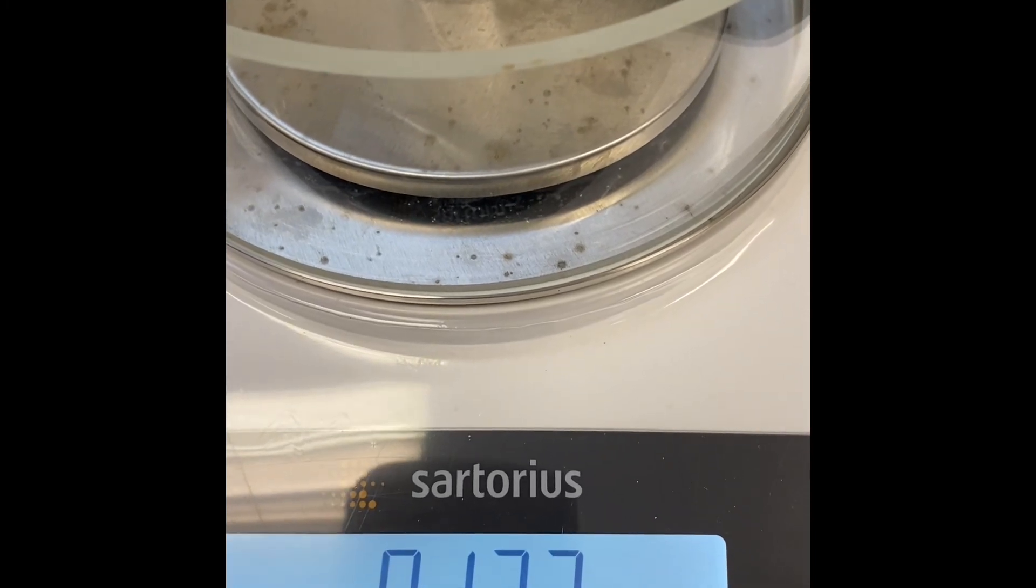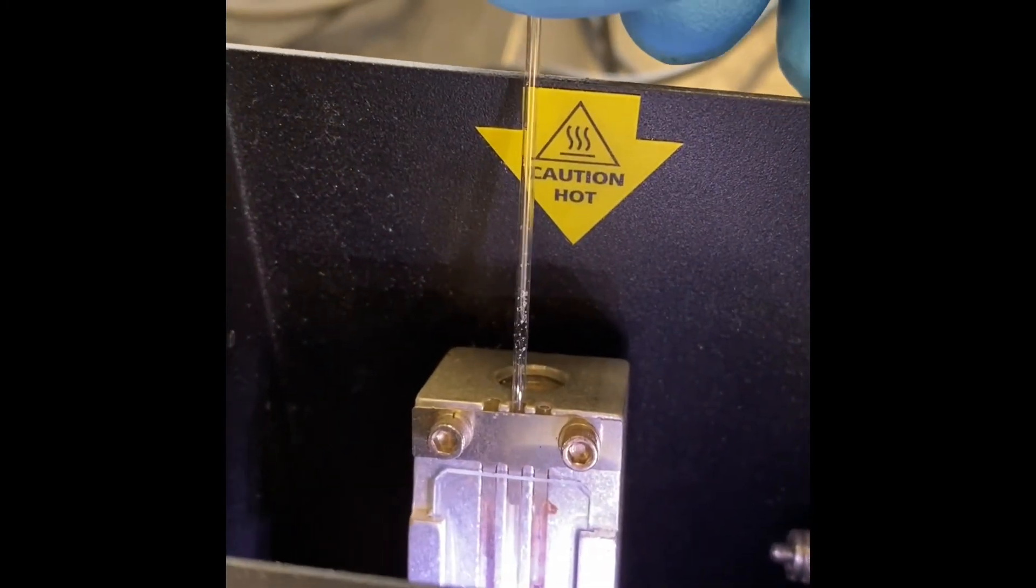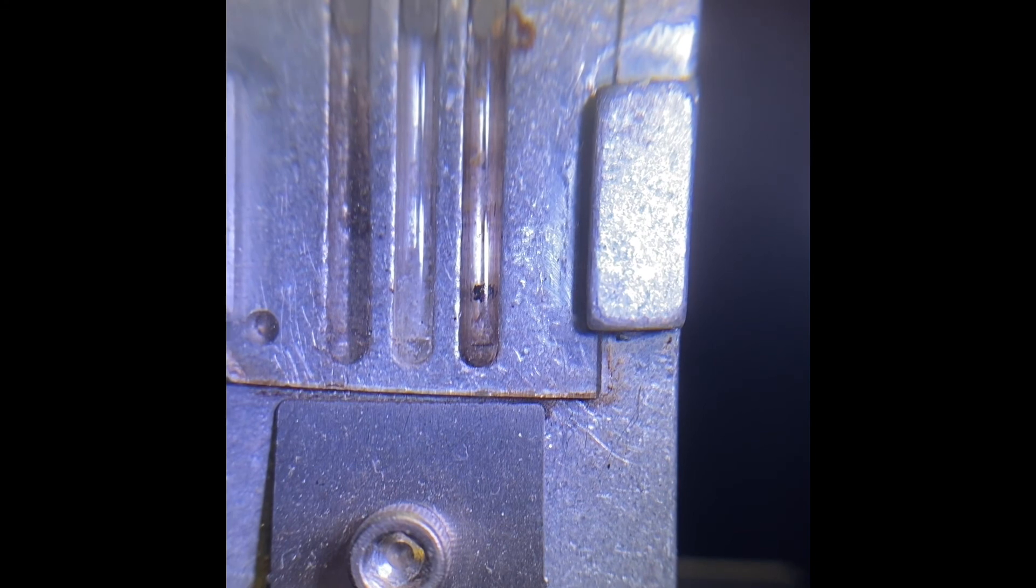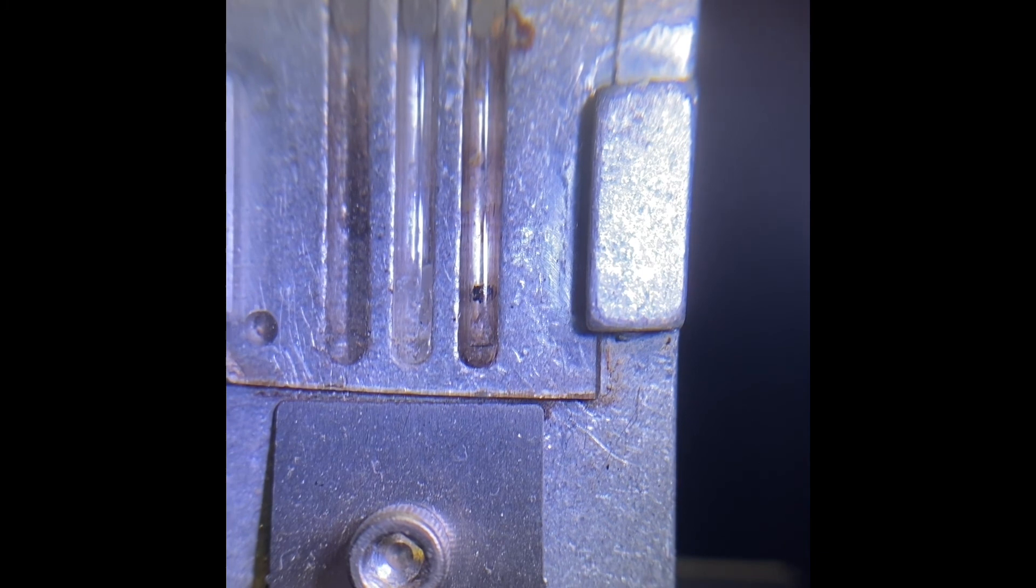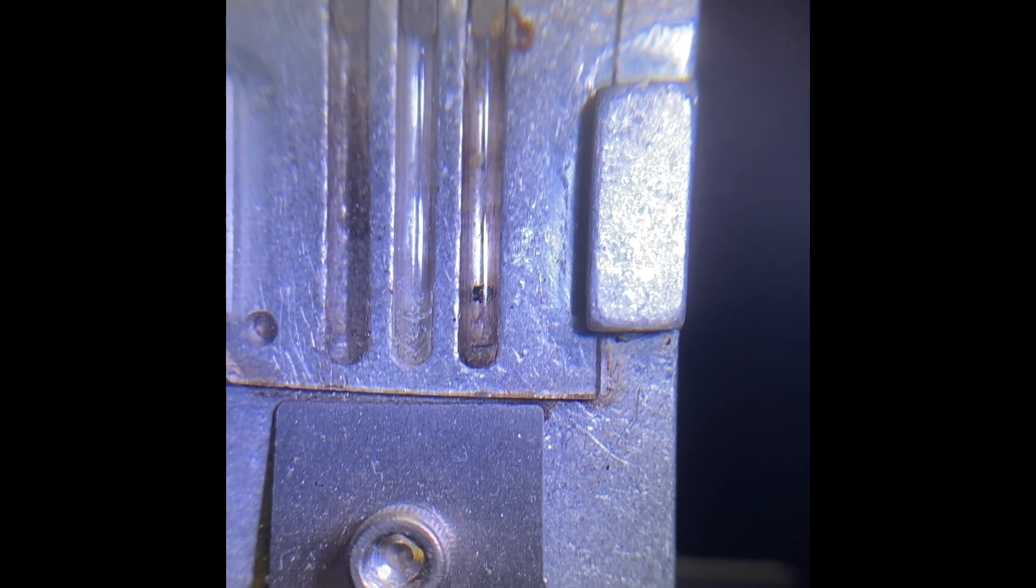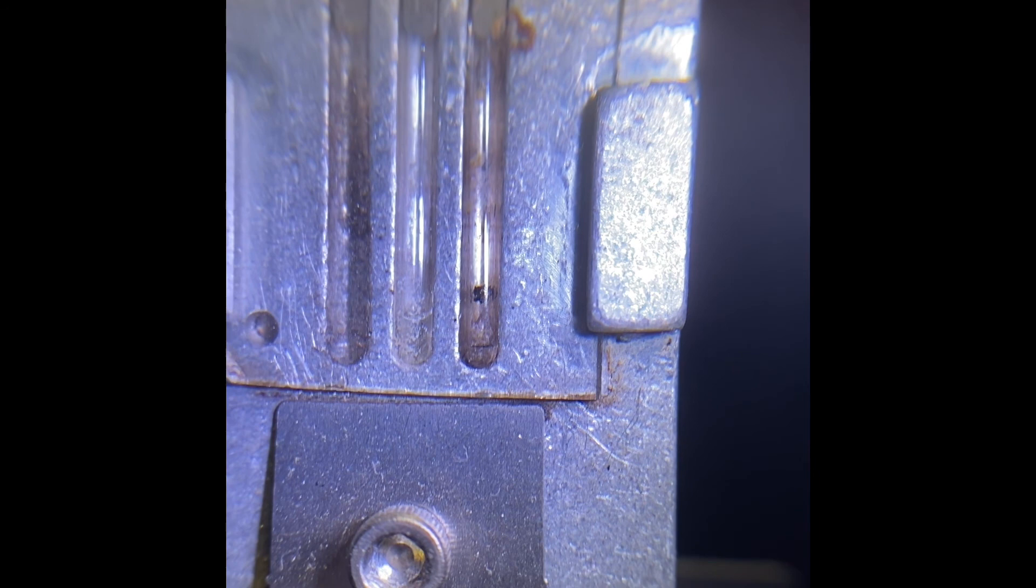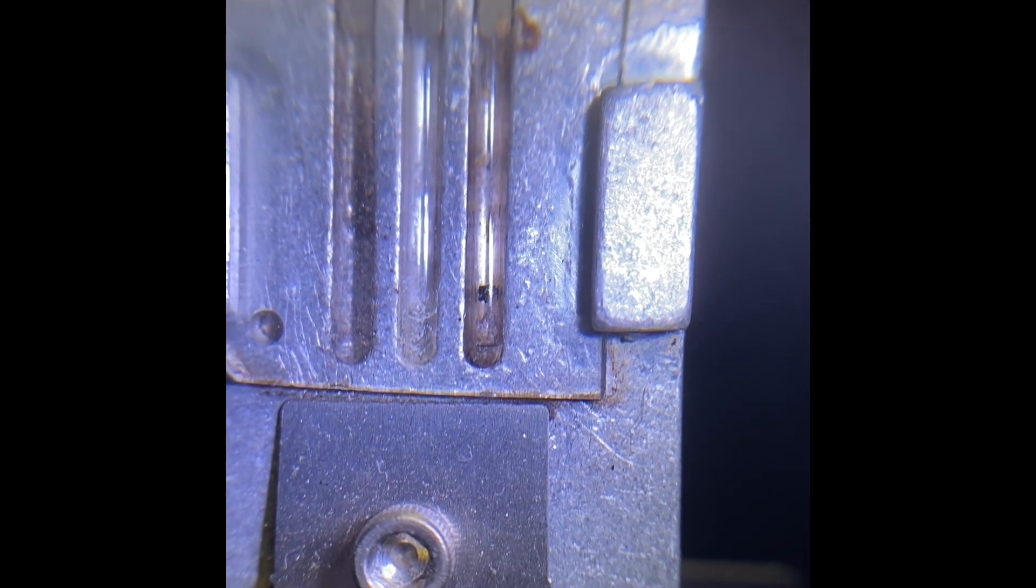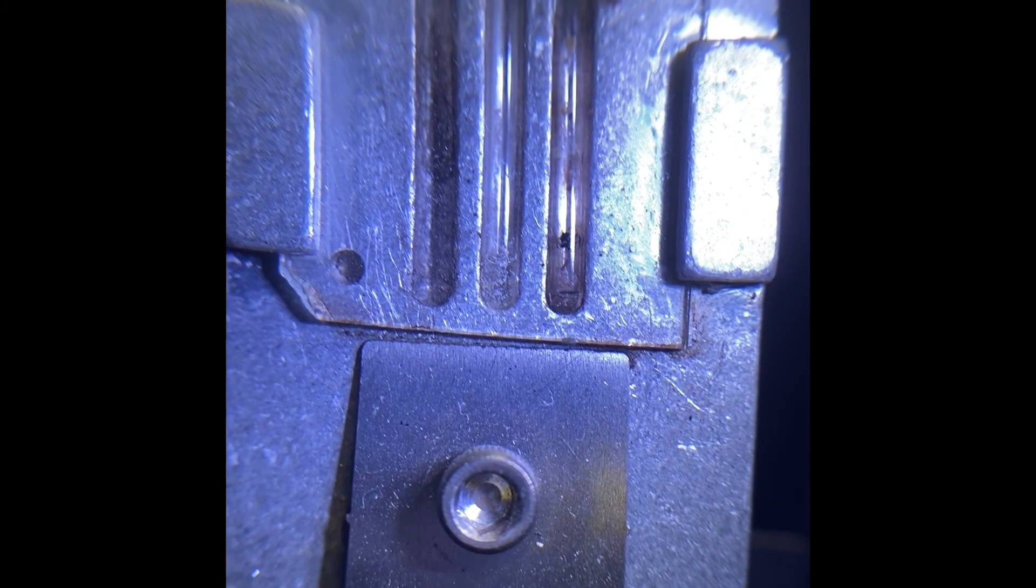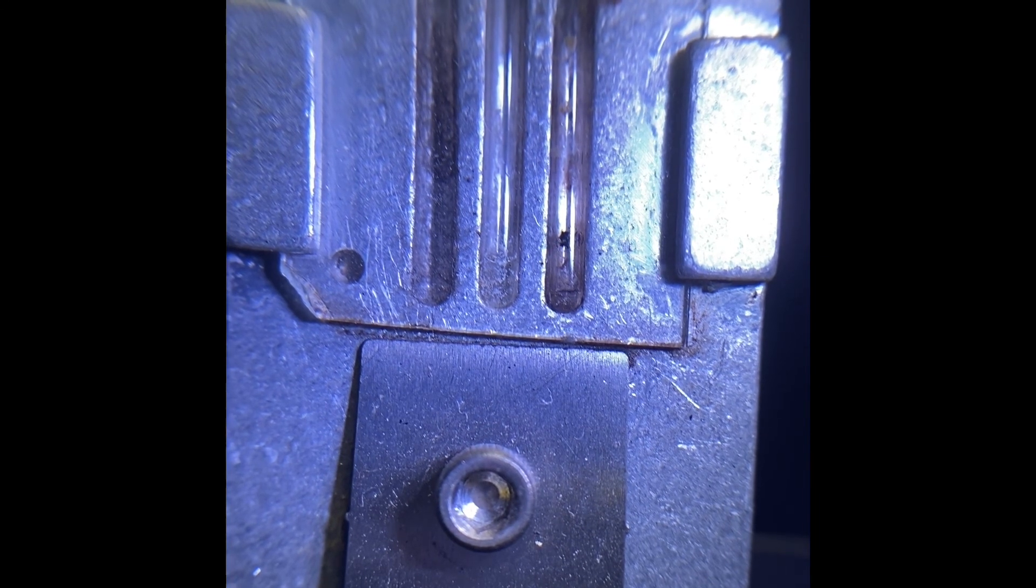After crystallization, that's the amount we have. Our sample is ready for melting point. It's starting to melt. And everything melted. So let's start 102.7, and it's done 105.1.